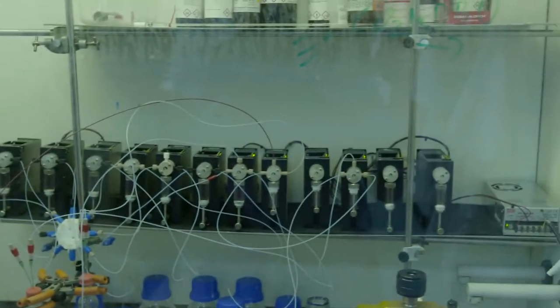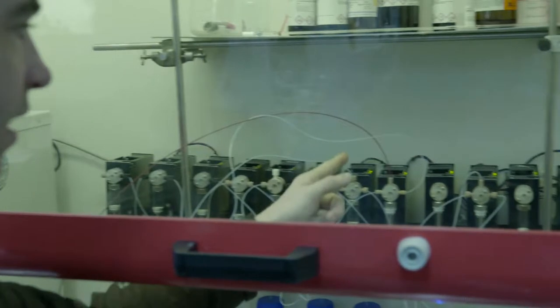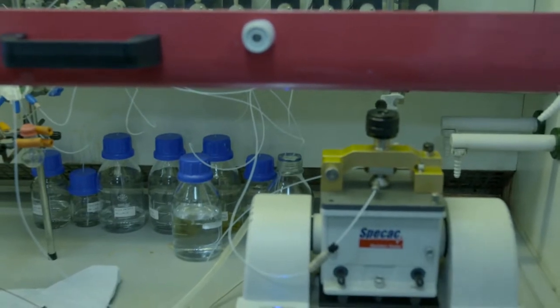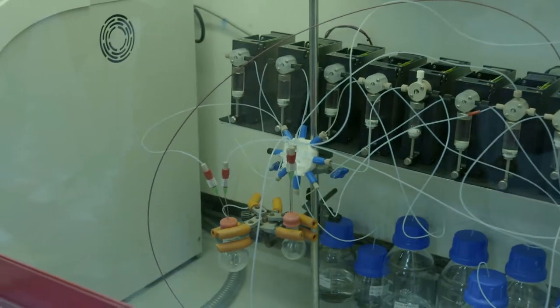What we've got here is each of those black things is like a pump and they're connected to some bottles which have chemicals in them. Each bottle is a different chemical, so you can imagine each pump basically gives us 1, 2, 3, up to 12 different chemical inputs — 12 ingredients for my cake. Now when you make a cake, the order of addition matters: if you put the eggs in the oven with no flour and the flour on top, no cake.